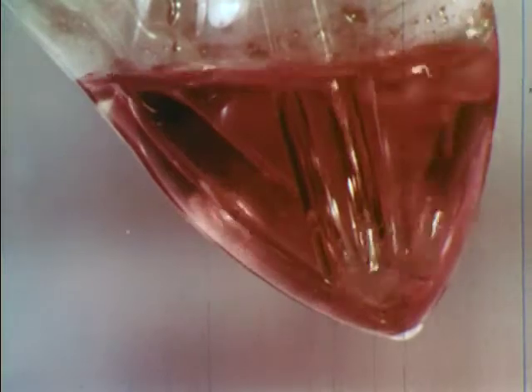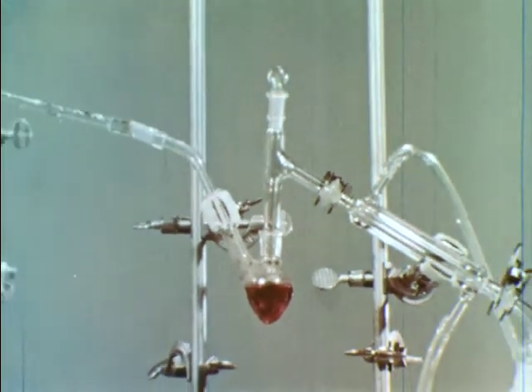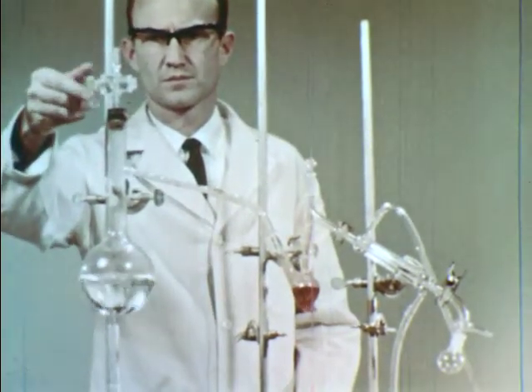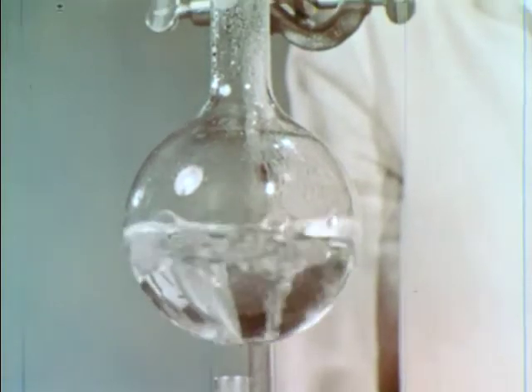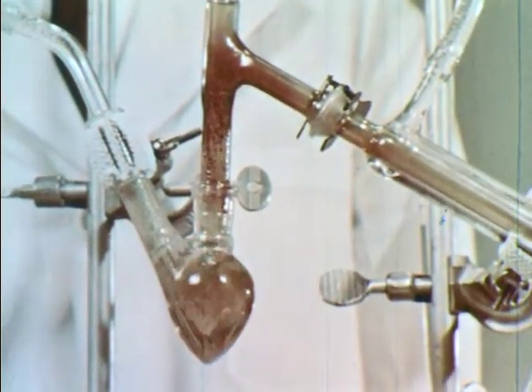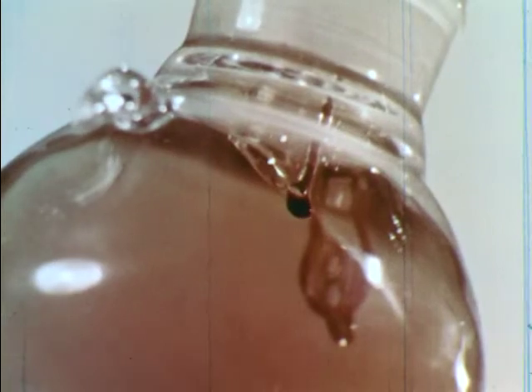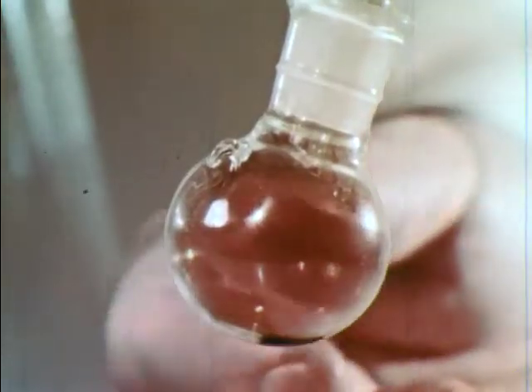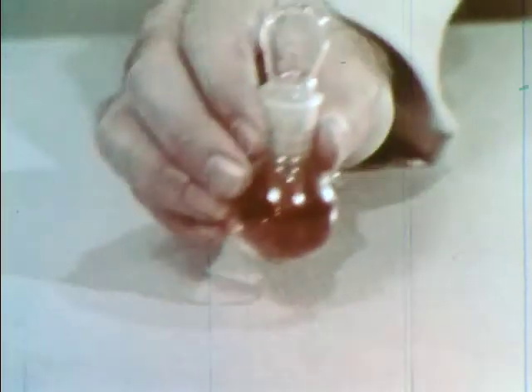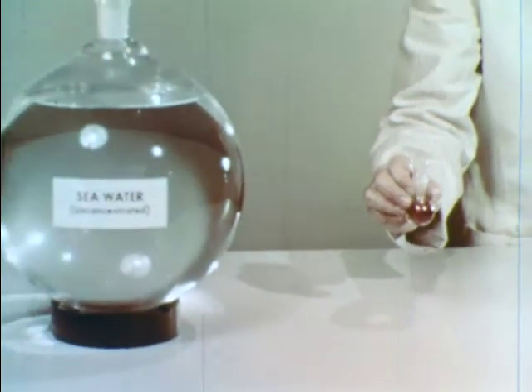Thus we have succeeded in concentrating the bromine from the seawater in a much smaller volume of solution. Since our goal is to obtain elemental bromine, how do we now remove the bromine from the water in which it is dissolved? We could blow it out with air, but to minimize loss of bromine into the air, we'll use live steam. The steam condenses as it passes into the solution, raising the temperature. Because bromine is more volatile than water, it distills from the solution. Relatively pure bromine condenses and collects in the receiving flask. On a laboratory scale, we have succeeded in obtaining less than one gram of bromine from this large volume of seawater.